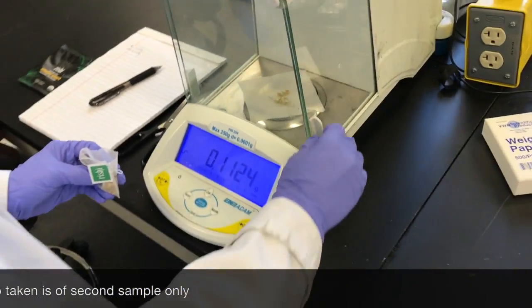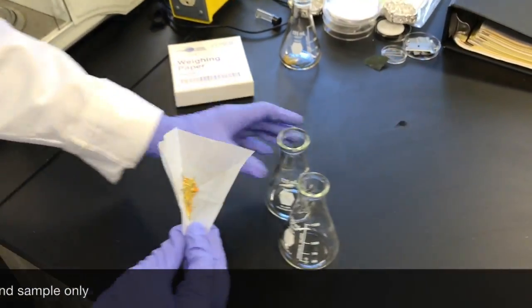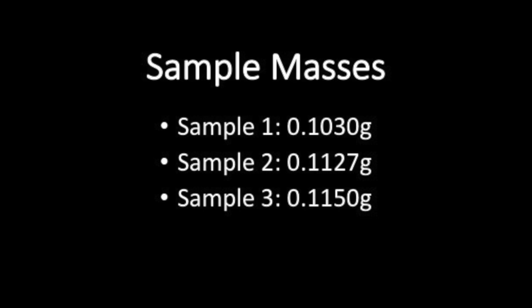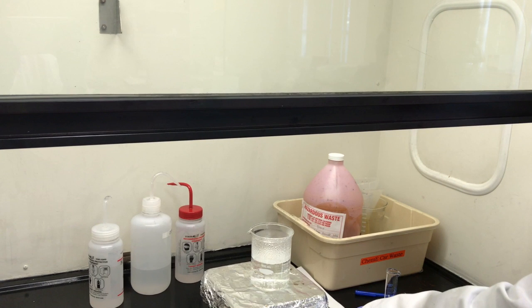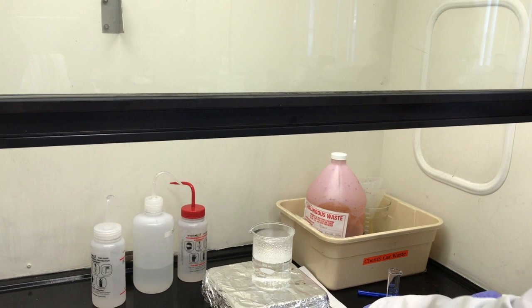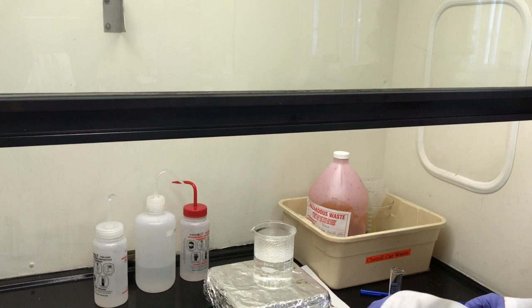Repeat for a second sample. Ours ends up being 0.1127 grams, and the third sample ends up being 0.1150 grams. Now that we have measured out the amount of tea, we will pour the samples into their corresponding Erlenmeyer flask while putting a beaker of distilled water on a hot plate to heat up.